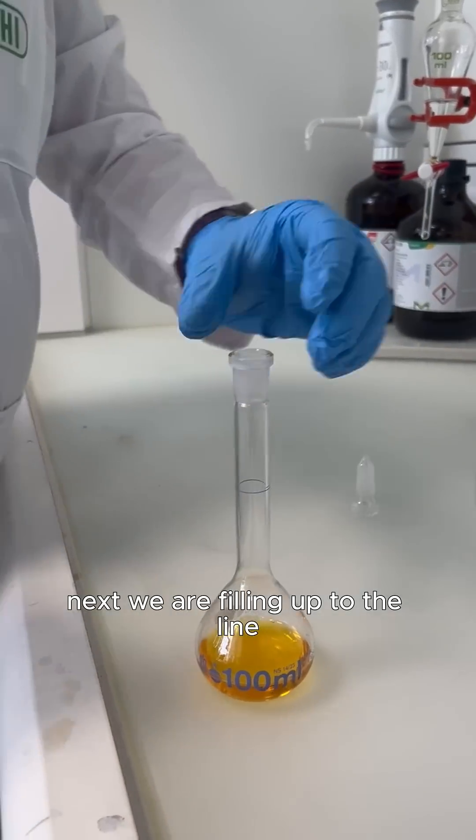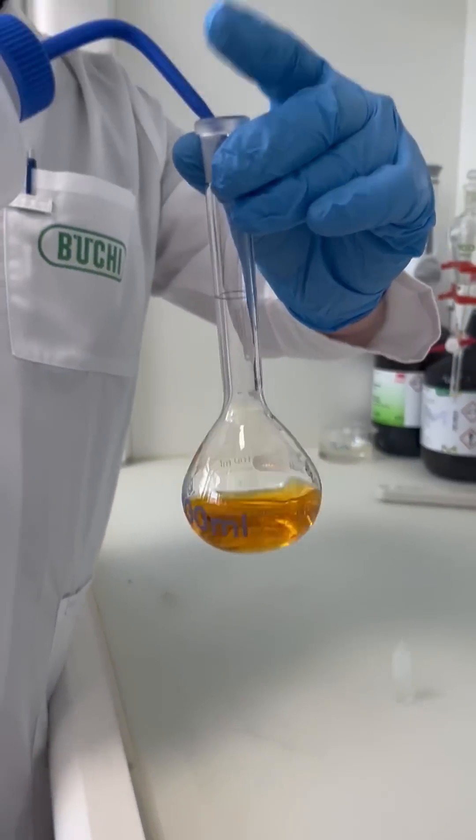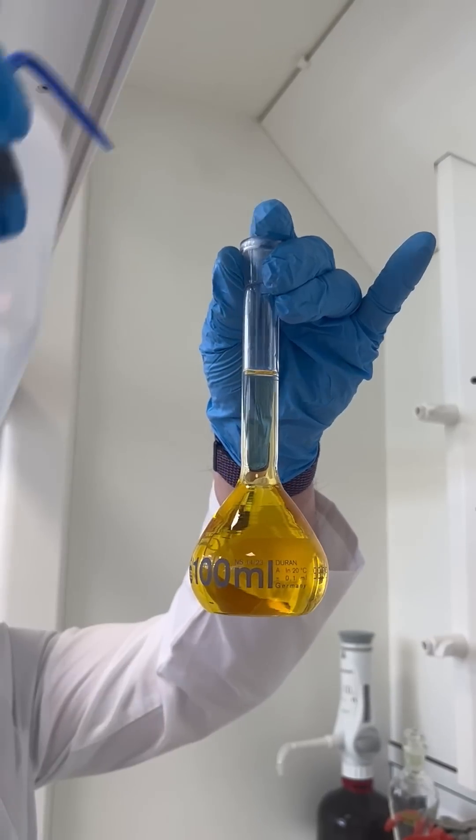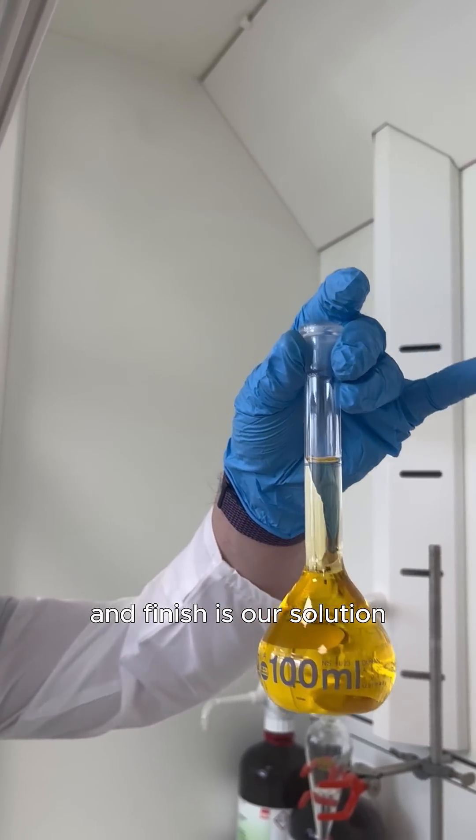Next, we are filling up to the line. And finished is our solution.